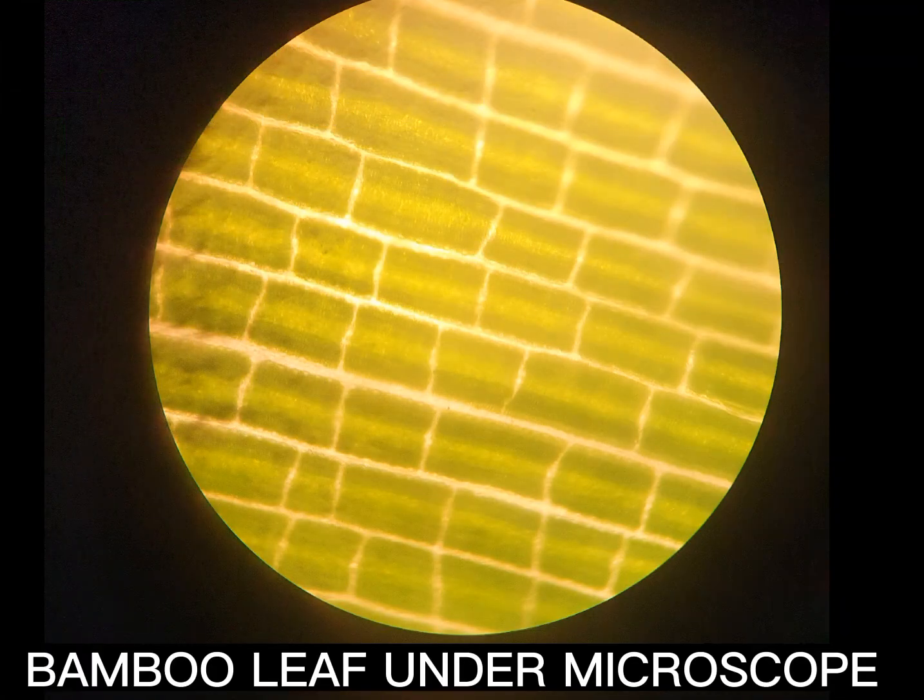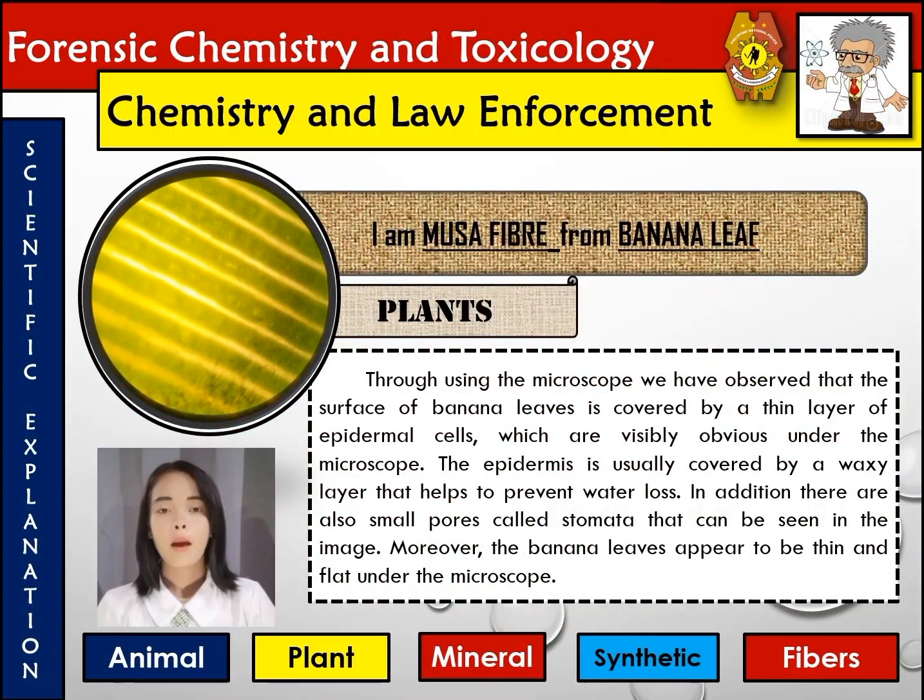Banana leaf. Through using the microscope, we have observed that the surface of banana leaves is covered by a thin layer of epidermal cells, which are visibly obvious under the microscope. The epidermis is usually covered by a waxy layer that helps to prevent water loss. In addition, there are also small pores called stomata that can be seen in the image. Moreover, the banana leaves appear to be thin and flat under the microscope.